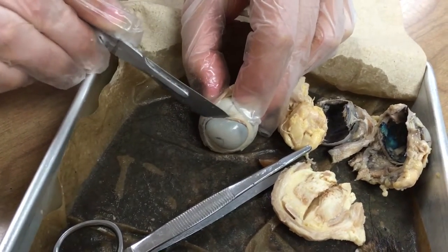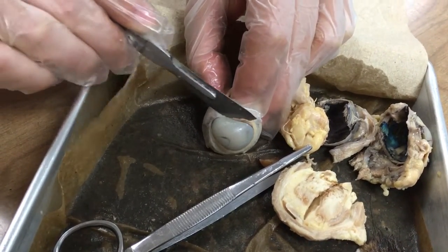I think that's the cerebellum. No, this is cerebellum — cerebral. Yeah.